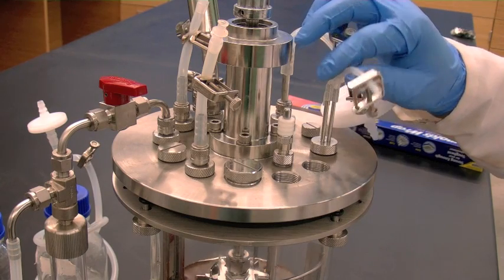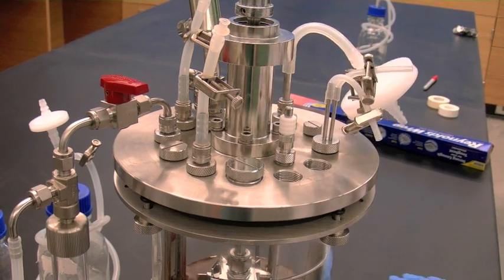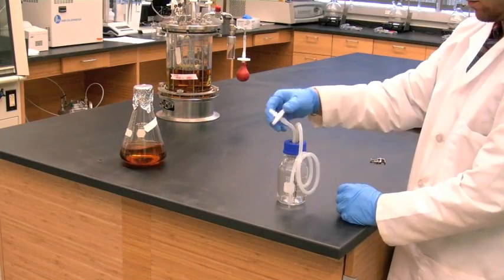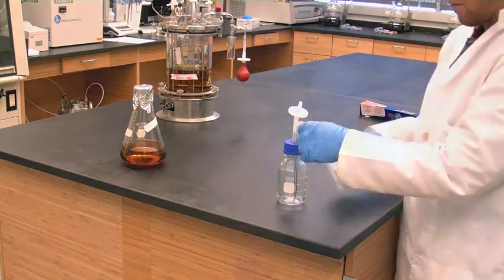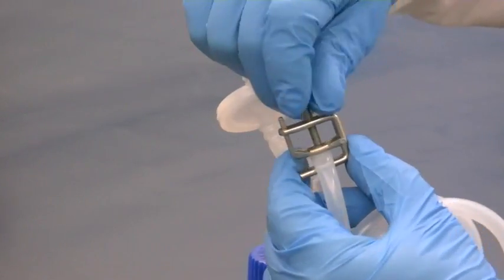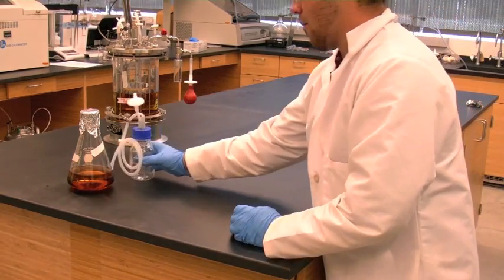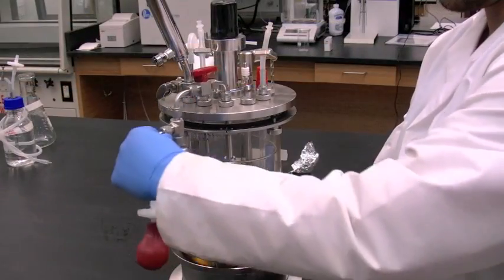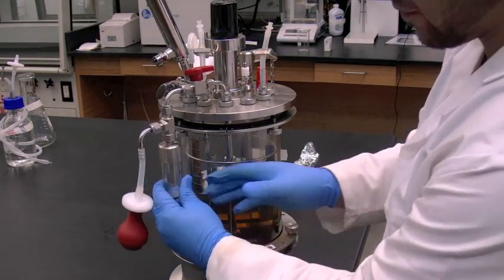Remove the resistance temperature detector from the thermal well. Make sure all solutions are covered with aluminum foil. Mark with indicator tape and label, and ensure that the sugar addition bottle is clamped. Loosen glass sample bottle on sterile sampler about one half turn.